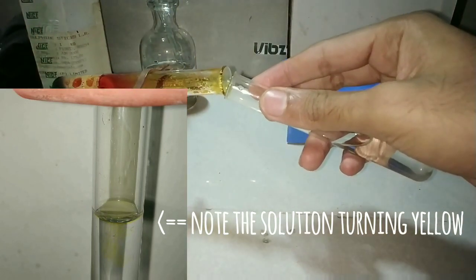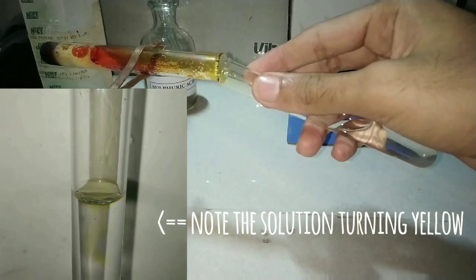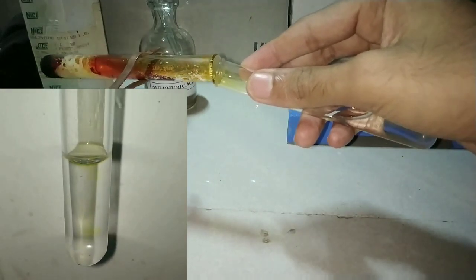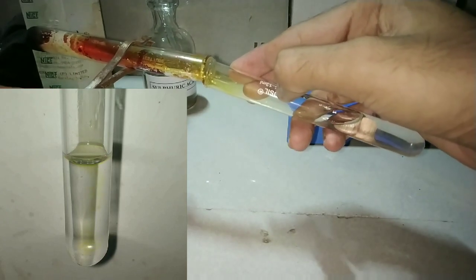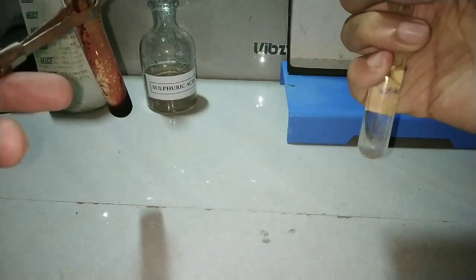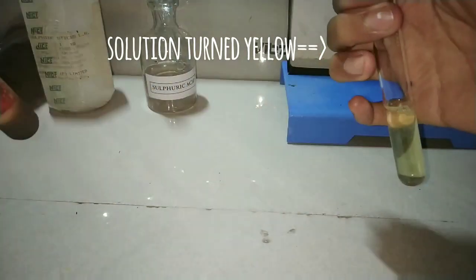This is actually a very crude method of collecting the gas by placing a test tube inverted over the other test tube. The actual methods involve a rubber cork with a glass delivery tube, but since those things are not always available in the chemistry lab, we use this technique. After collecting the gas, shake the tube vigorously — the solution has turned yellow.